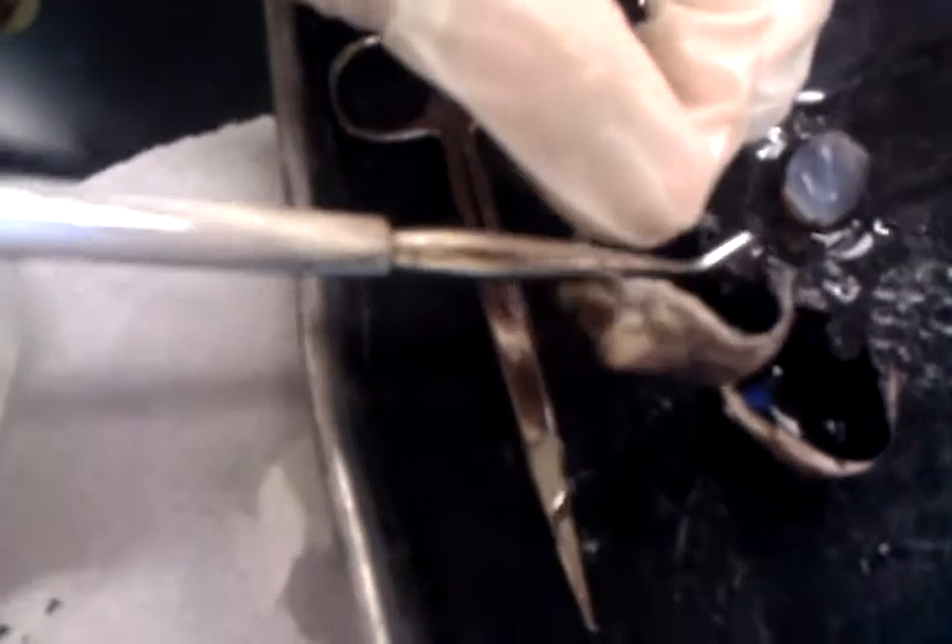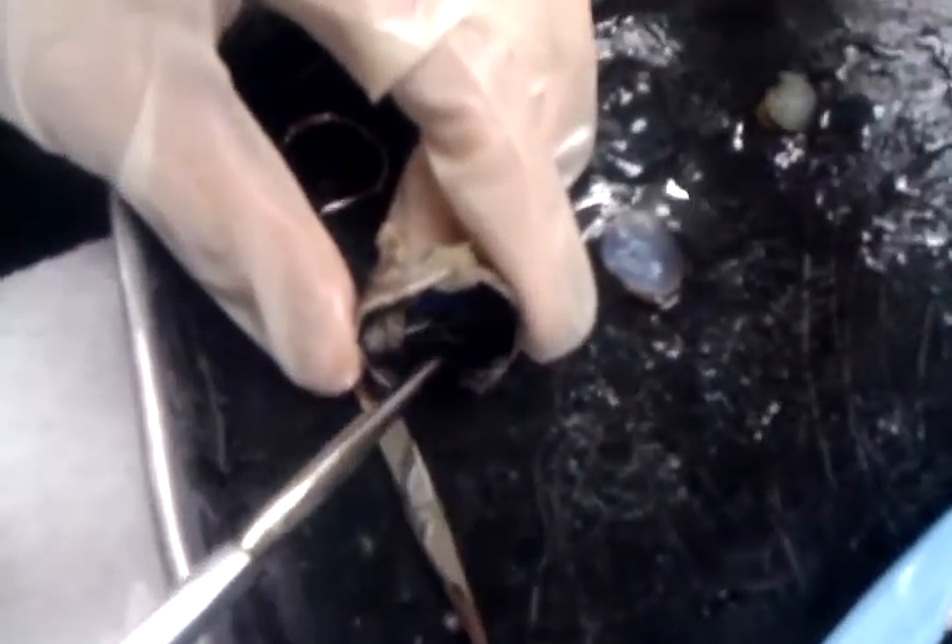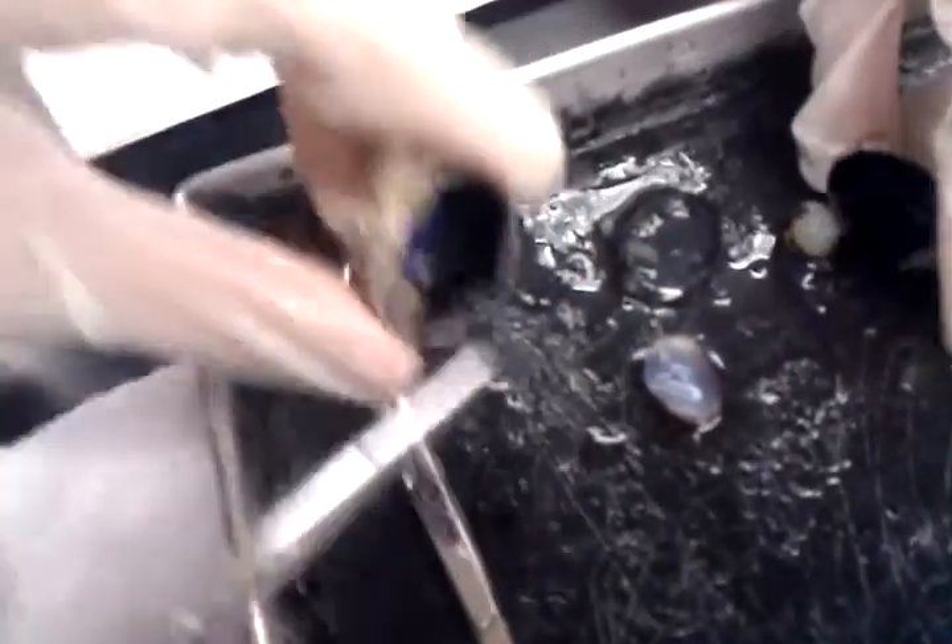The ciliary body is actually inside right there. You can't really see the detail, but it's around the opening — the groove area. It's like right here. The grooves, right? You can see — it has ridges, so it's like texturized.